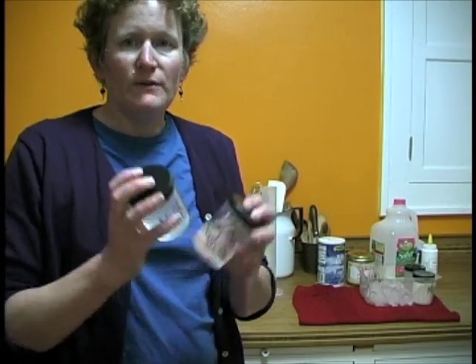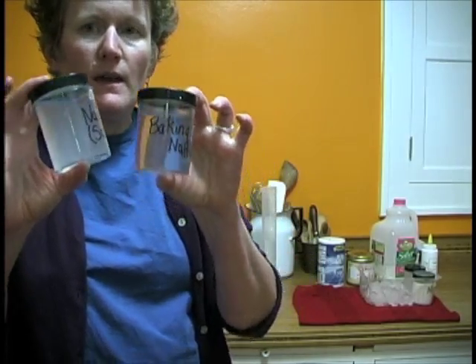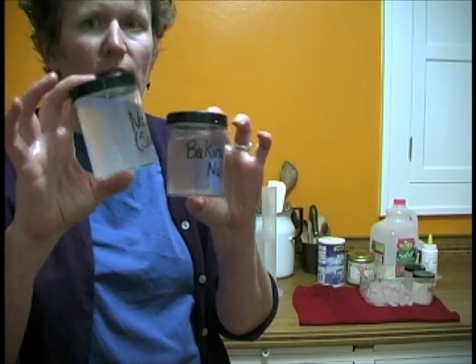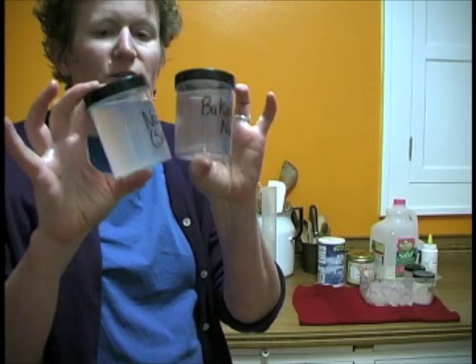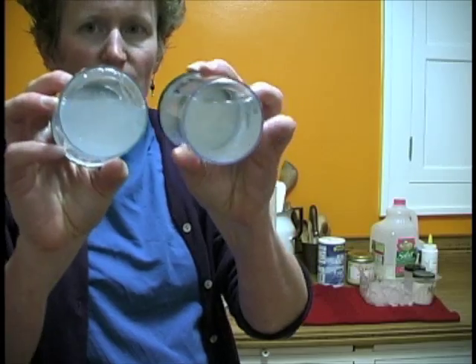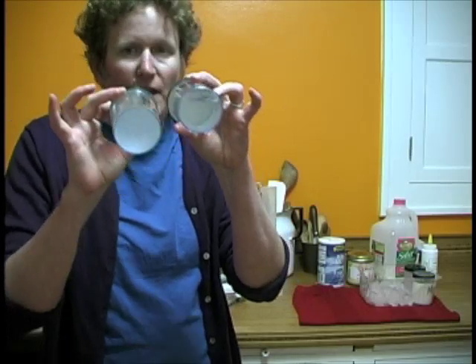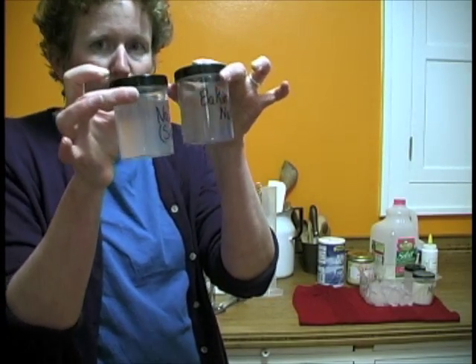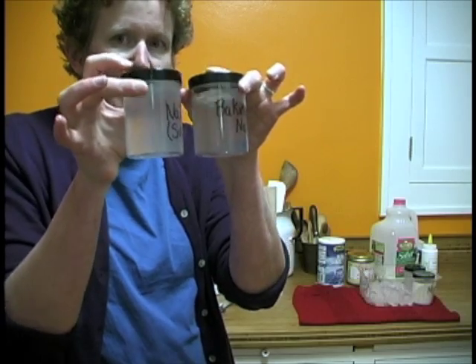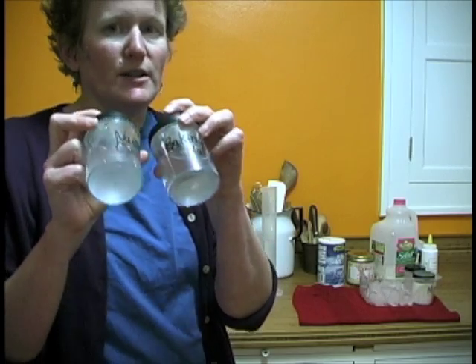On the last part of part C in the lab, we've taken our two solutions, baking soda and sodium chloride, and we've run them under hot water to heat up the mixture. And we found that the solid we saw on the bottom before is now gone. So the solid that came out of the solution is now back in the solution. It's now been dissolved. So these two are solutions.